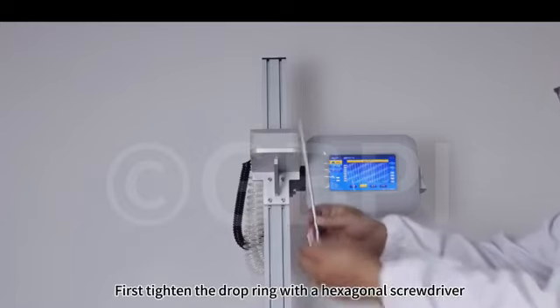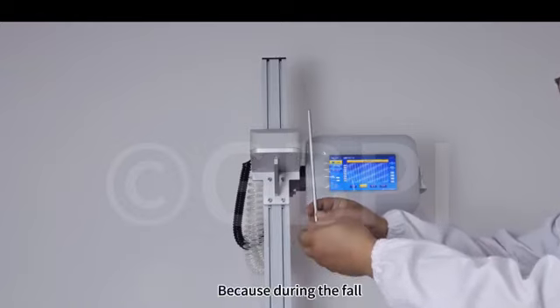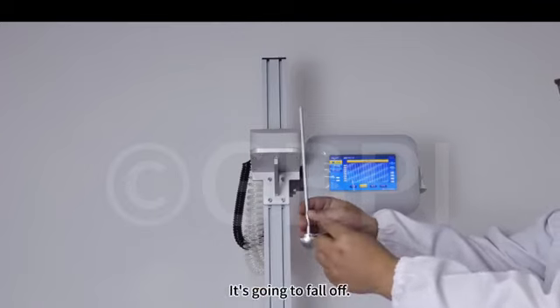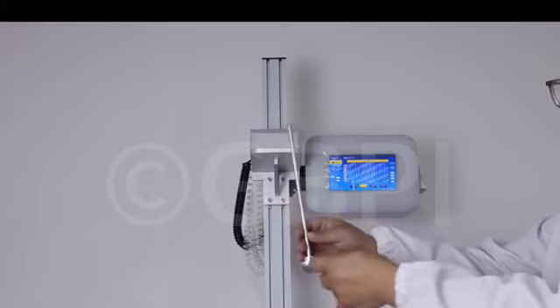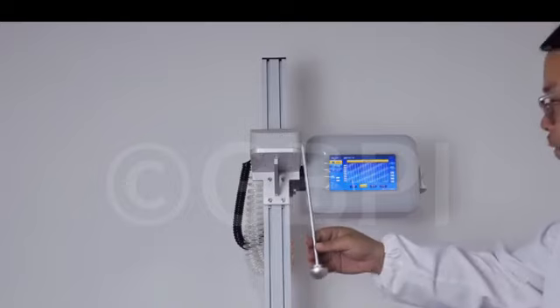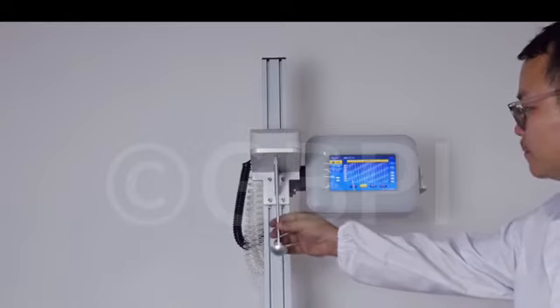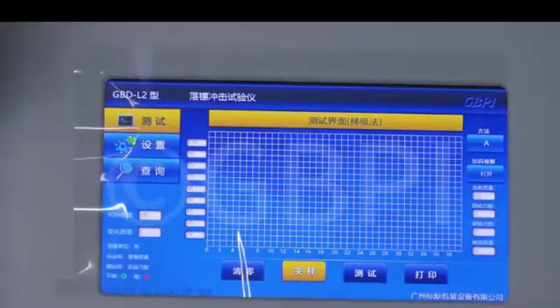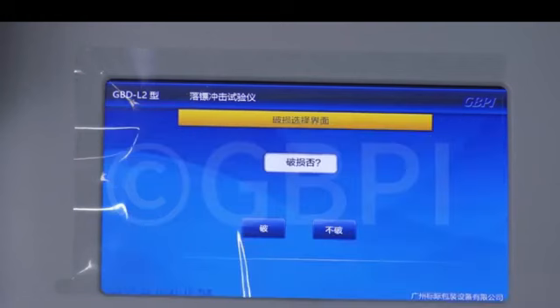First, tighten the drop ring with a hexagonal screwdriver. Why tighten it? Because during the fall, if this ring is not tight, it's going to fall off. Equipped. Click Test. The screen will prompt us whether the sample is damaged.